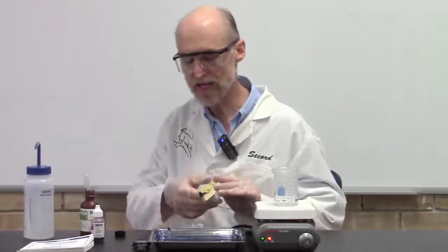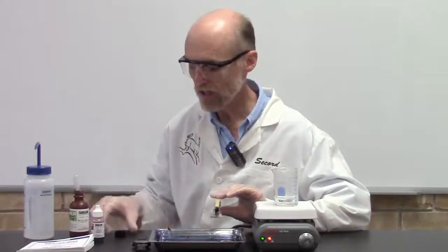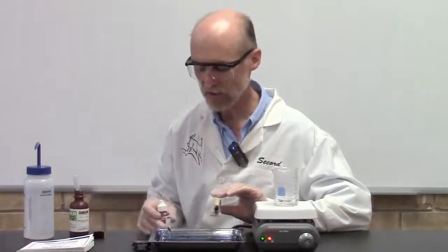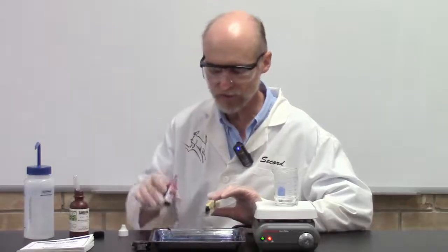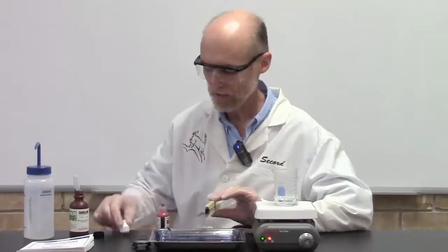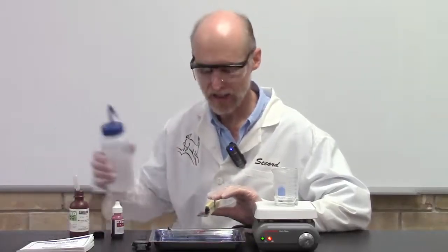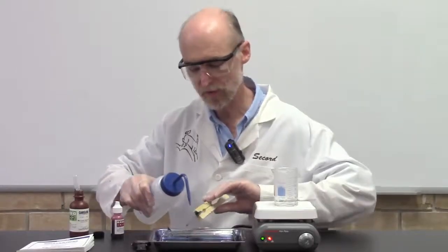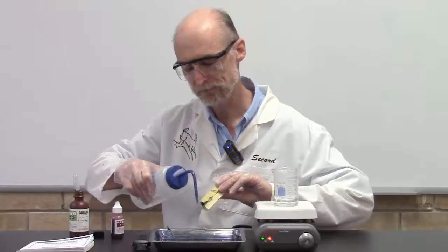Now you're ready to apply the safranin. You do not blot after you rinse off your spore stain. Just put the safranin right on top of it. The safranin will stay on the bacterial smear for 30 seconds. So we'll let that sit there for 30 seconds. Then we will rinse both sides. Get all that extra stain off of there.